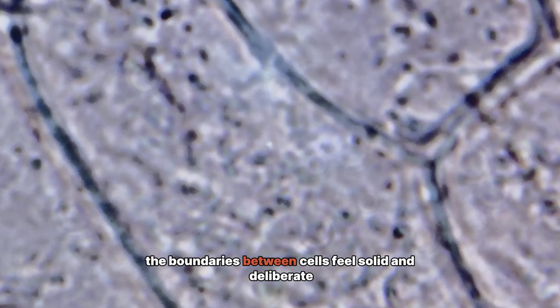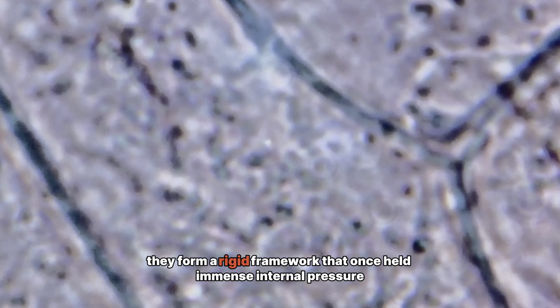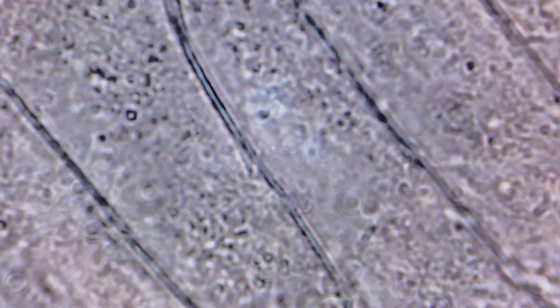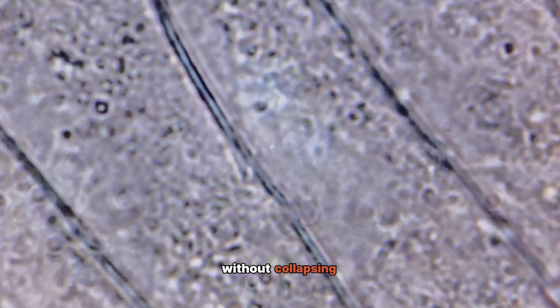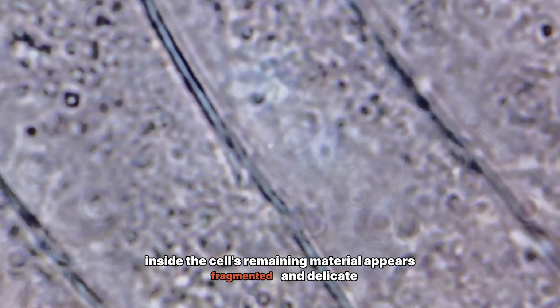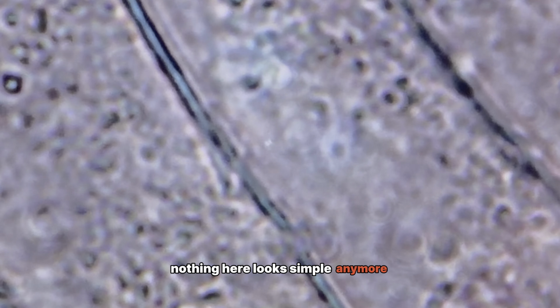The boundaries between cells feel solid and deliberate. They form a rigid framework that once held immense internal pressure. This framework is what allowed the onion to store so much water without collapsing. Inside the cells, remaining material appears fragmented and delicate. Tiny particles and faint structures float in the background. Nothing here looks simple anymore.